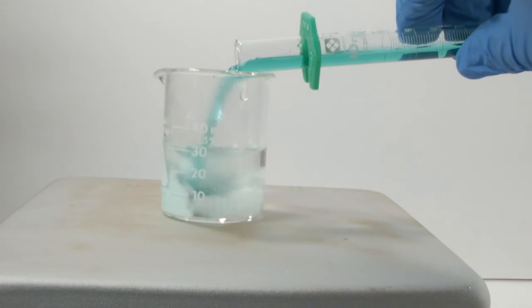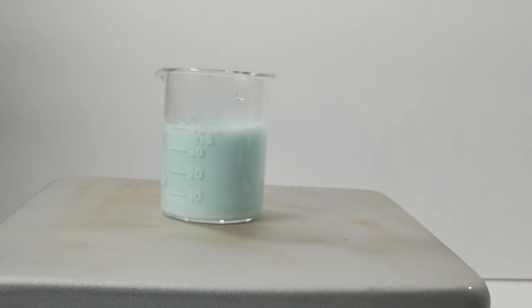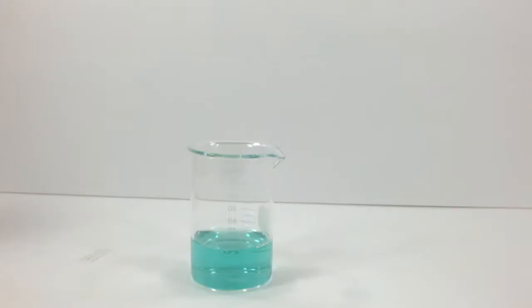Anyway, I have some barium nitrate. Can I make the hexamine nickel-2 nitrate complex too? This is a solution of barium nitrate, and I added the nickel sulfate directly to it. After leaving it stir for a bit, I put it in the fridge and filter just like I did before. Et voila, this is now a solution of nickel nitrate. Let's add the ammonia and see what happens.